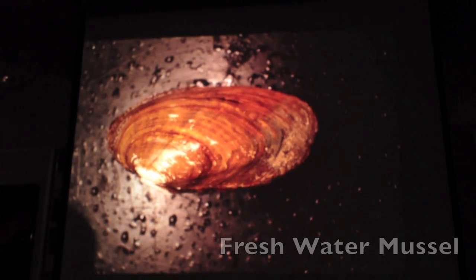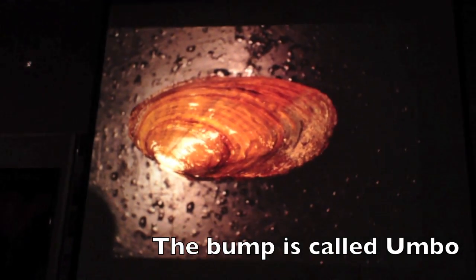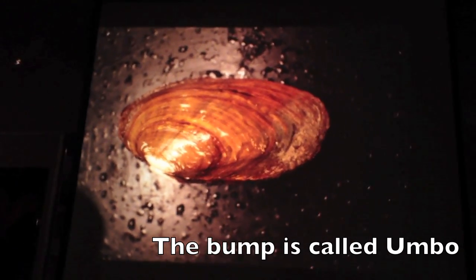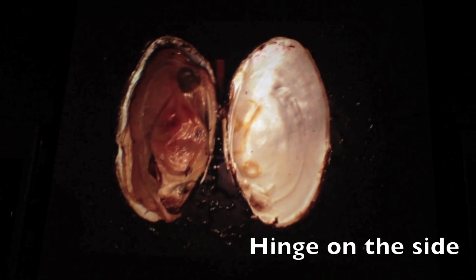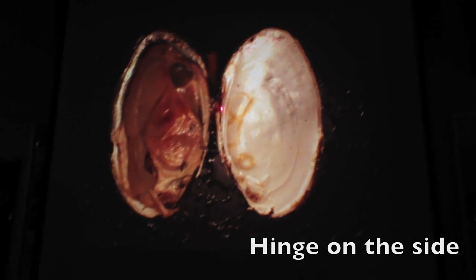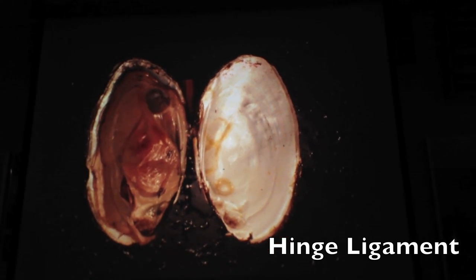And so, what's this little bump here called? That's an umbo. So this is the clam opened up. What's this area right here? Where it was connected? The hinge ligament is tissue, that's just the hinge.